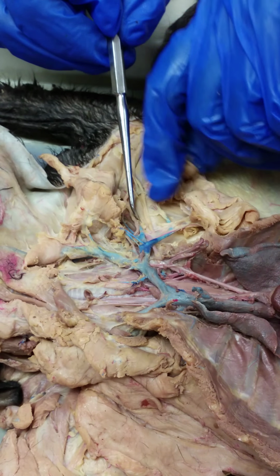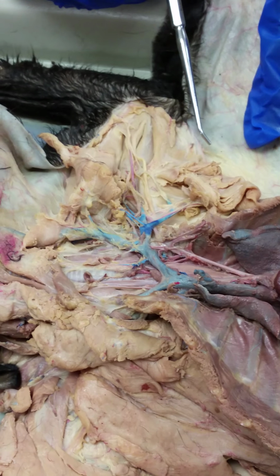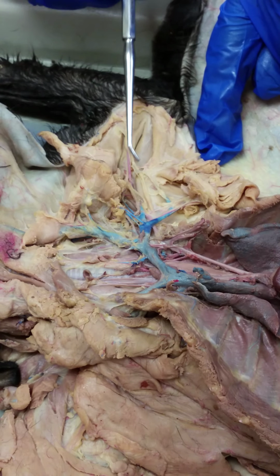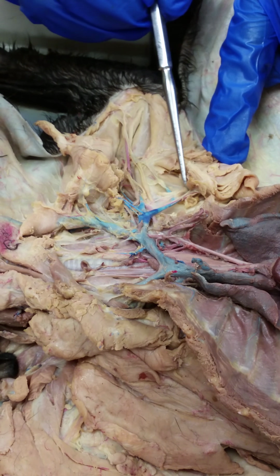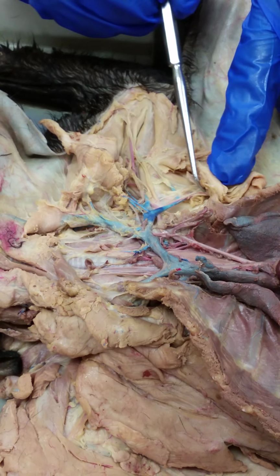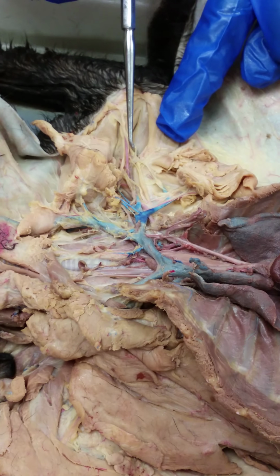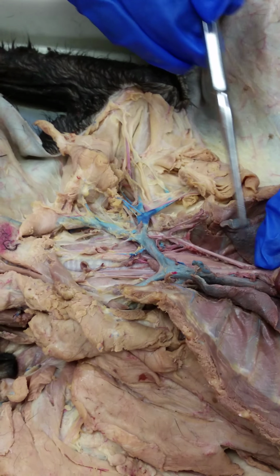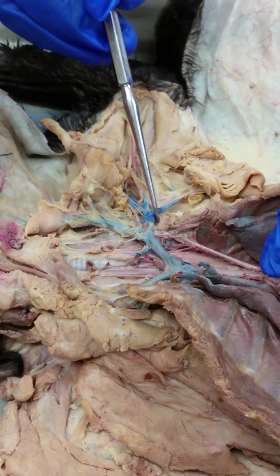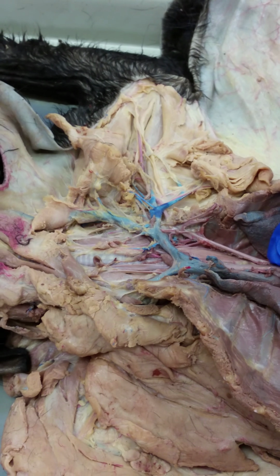And as we continue down, the other artery that runs kind of parallel to that and also goes posterior is the thoracodorsal. So we have axillary, long thoracic, and then after the long thoracic branches off, it's now called the brachial artery. And then the thoracodorsal branches down. So this one artery has three names: the left subclavian, the axillary here, and then the brachial artery here.